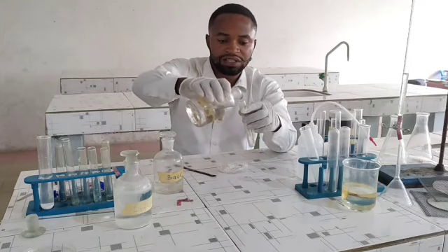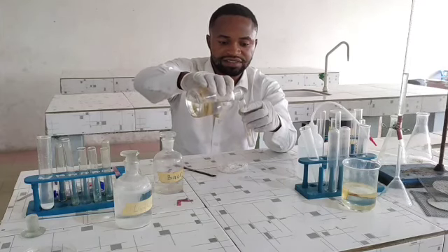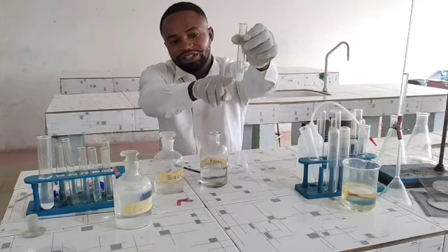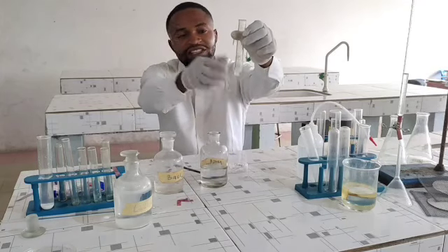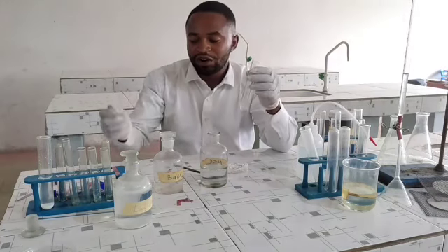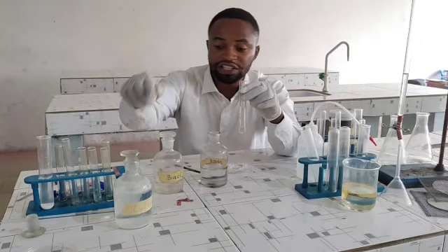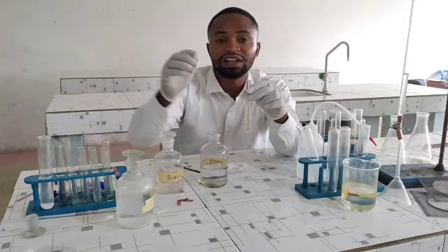I'm going to add hydrochloric acid. Did you see the effervescence occur? Did you see that, please? Effervescence has occurred. A colorless and odorless gas has been released. If I test it with lime water, it's going to turn lime water milky.